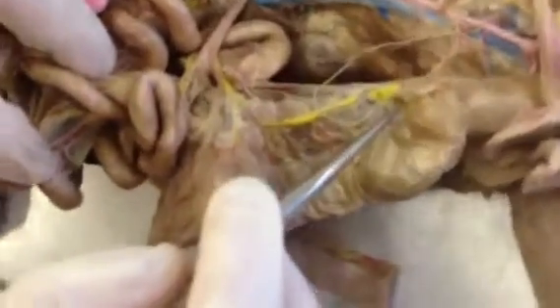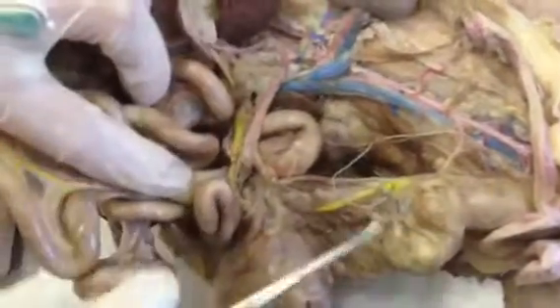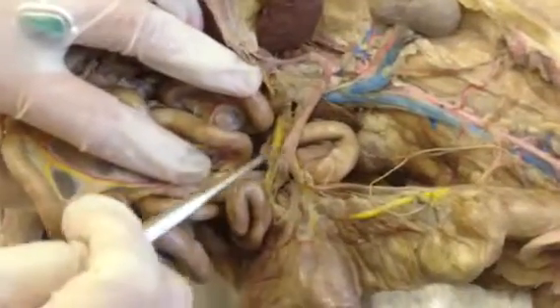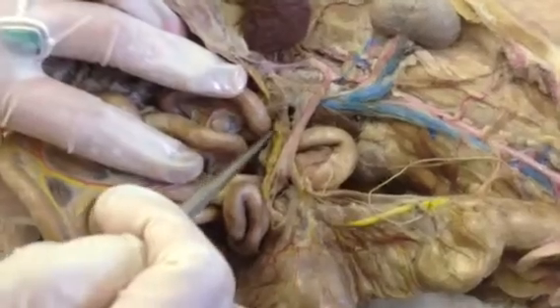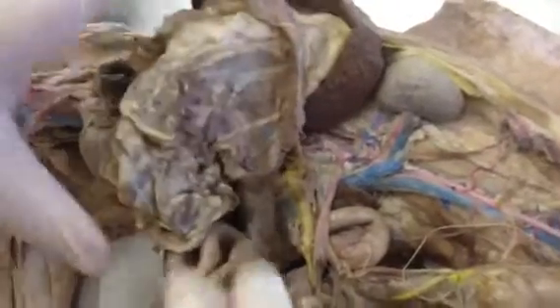Okay. And then finally, let's just look over at the hepatic portal vein system. So down here from the large intestine is the inferior mesenteric vein. It comes up here. This is kind of a smaller vein, but this is going to be the superior mesenteric vein right here, and they both anastomose right here to become the hepatic portal vein, which is also joined by the gastrosplenic vein, coming from the spleen and the stomach, which also anastomoses with the hepatic portal vein into the liver. Okay.